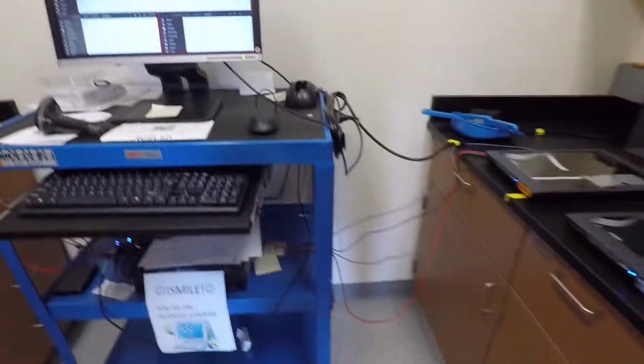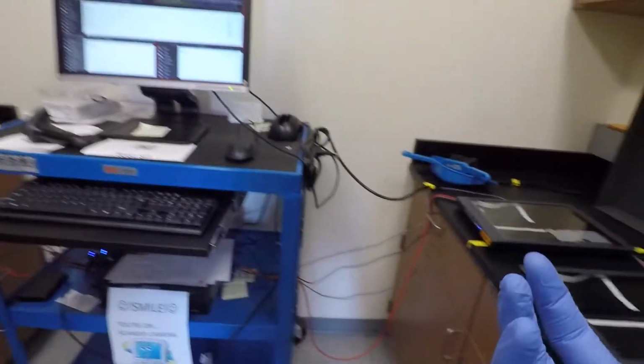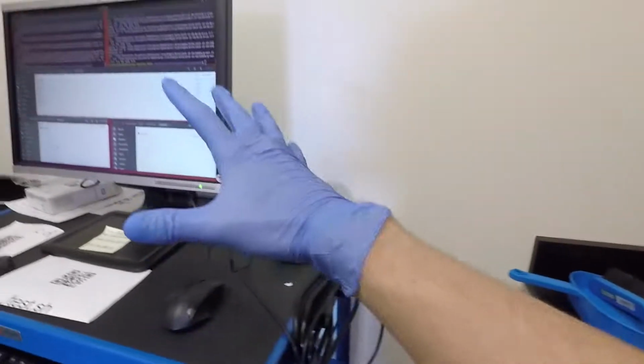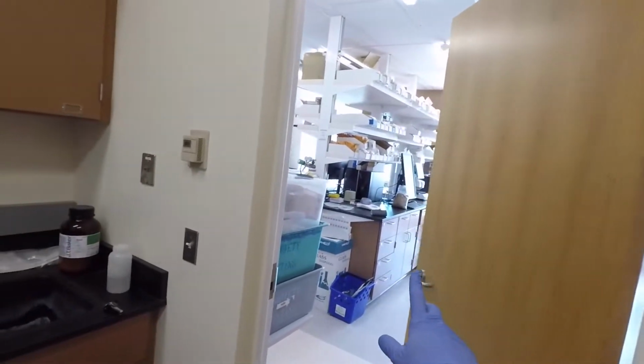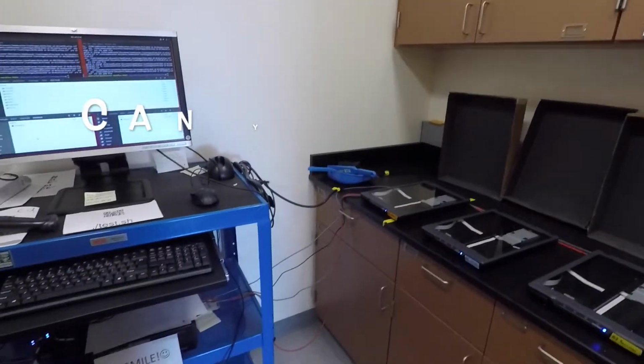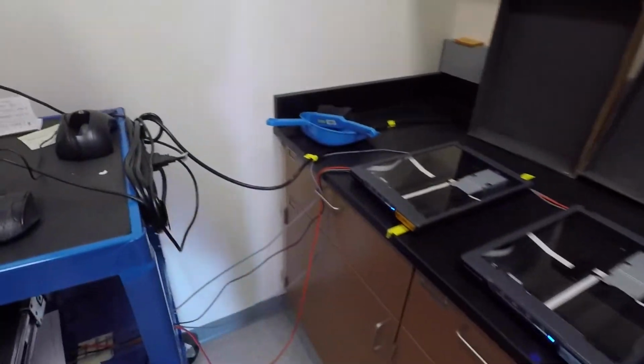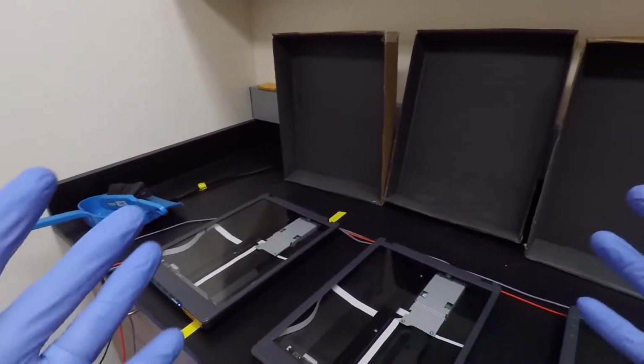because that's going to make sure that we're not losing samples where we scatter a sample, we don't have the image, and we remove that seed, because then what we have to do is go back and get a new subsample, put it back on the scanner, run it again, and that's after we figure out that we are missing it. So this is a protocol that we set up to have quality assurance and quality control during the scanning.